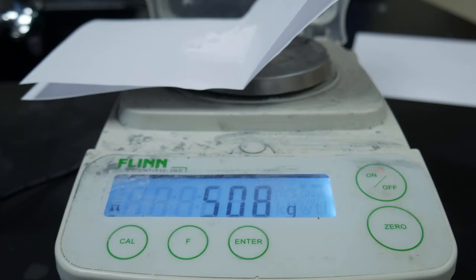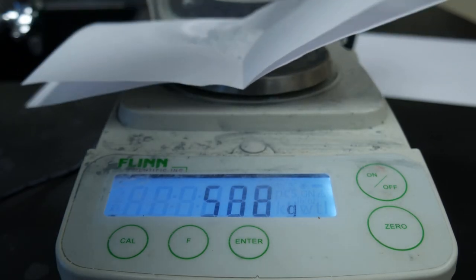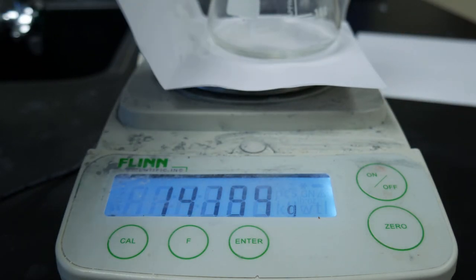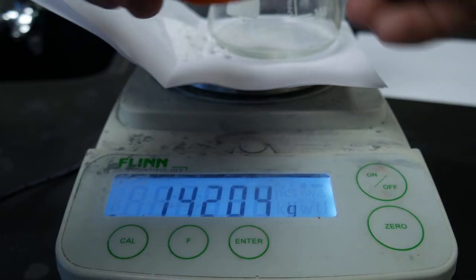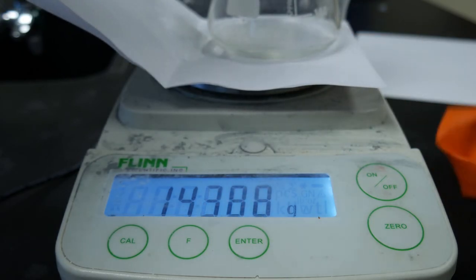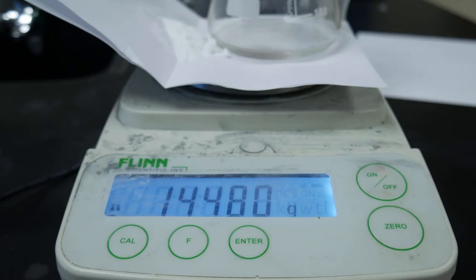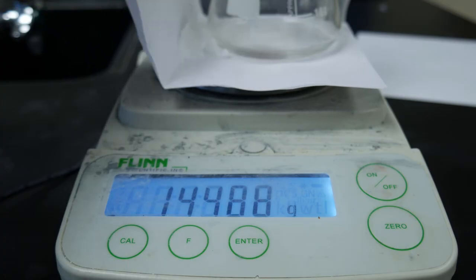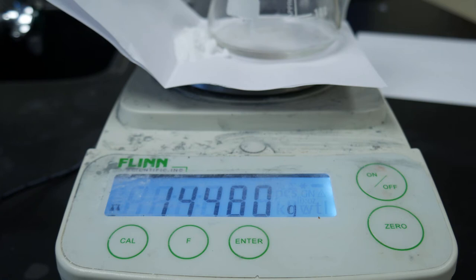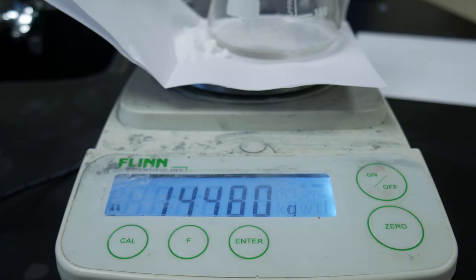Now we're going to take the mass of our flask and vinegar, our baking soda, and our balloon and put all of them on the scale to see the total mass of all our reactants. We have 144.80 grams. Record that on your data table for trial number three as the total mass of our reactants — 144.80 grams.